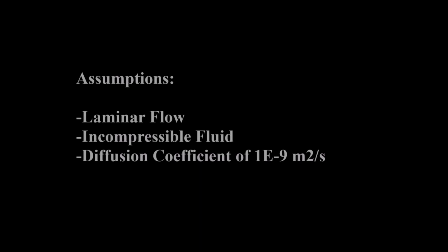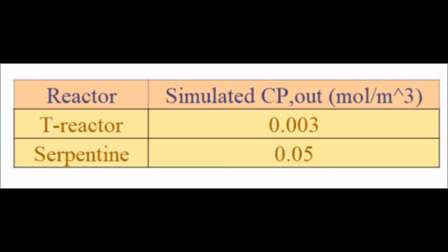Some assumptions that we made for the COMSOL simulation include the following. The reactor flows in the laminar regime, the fluid is incompressible, and the fluid has a diffusion coefficient of 1 × 10⁻⁹ meters squared per second. We used the surface average function to find the average concentration of product at the outlet.